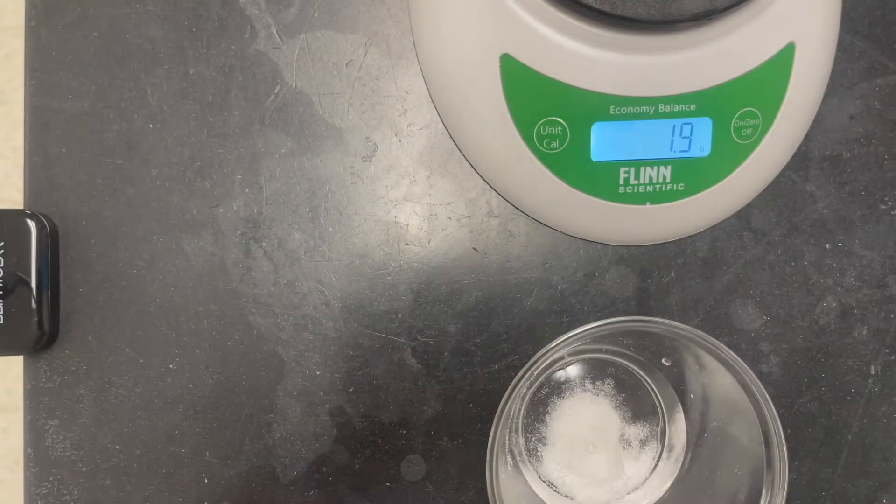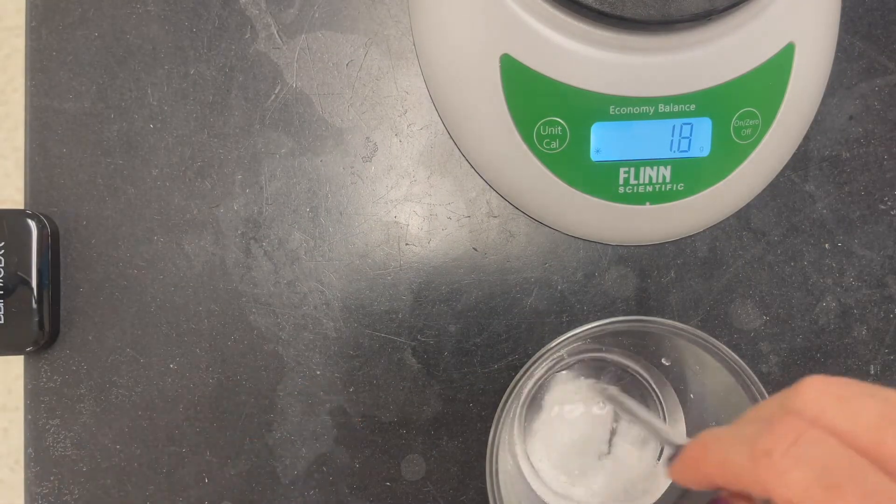Pour the Sodium Carbonate into the water and stir until it is dissolved.